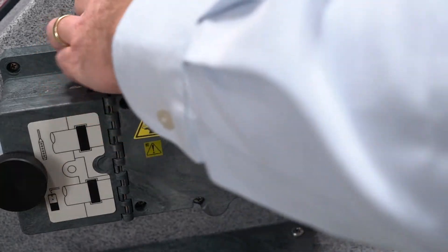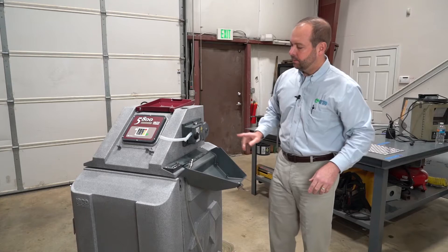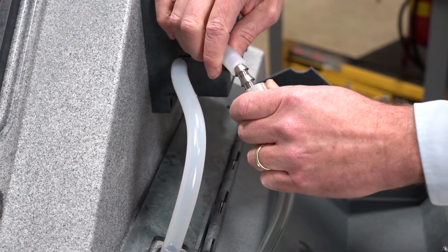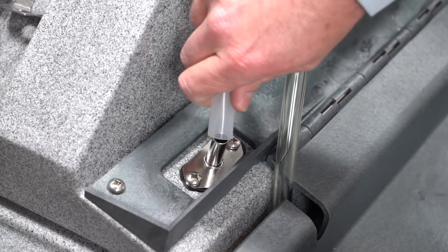Close the pump housing band and secure with a latch, then connect the end of the pump tubing — the top section to the suction strainer, tubing coupler, and the pump manifold.